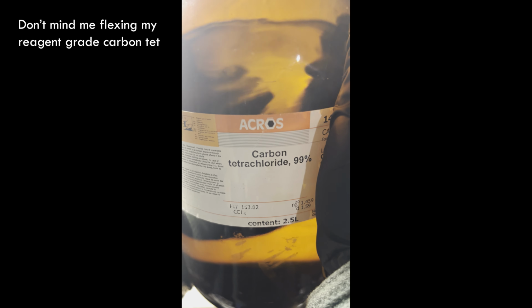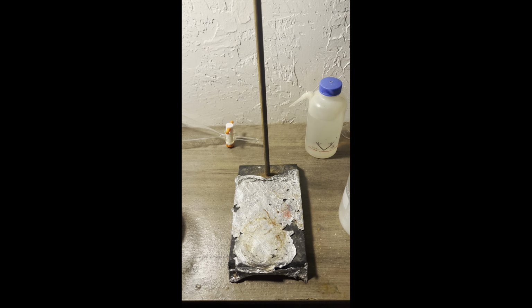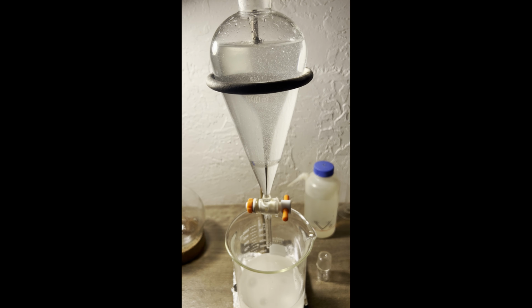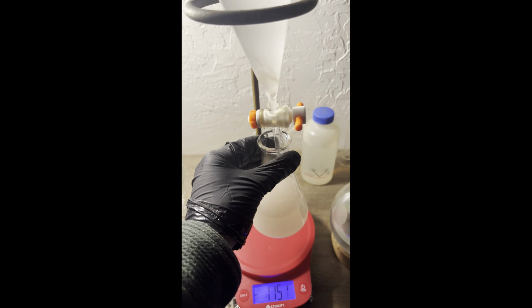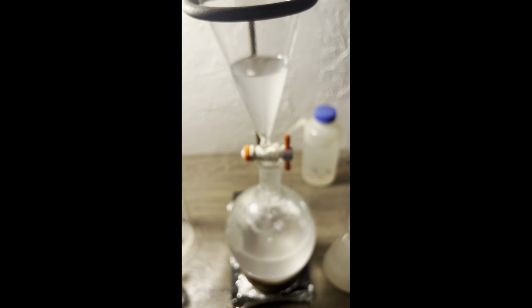Methyl benzoate has a density of 1.0837 grams per milliliter, fairly close to that of water, so they don't separate as sharply as is ideal. To get a better separation, carbon tetrachloride is added to increase the density of the organic layer. Using a scale to weigh the crude organic layer was pretty pointless since I used a little more carbon tet to rinse out all the glassware.